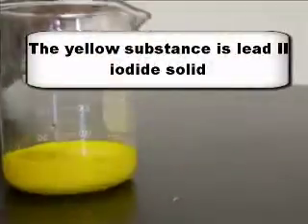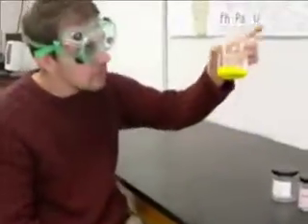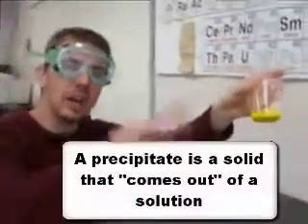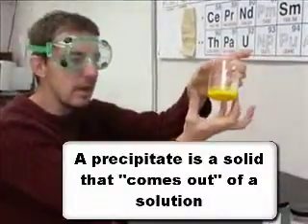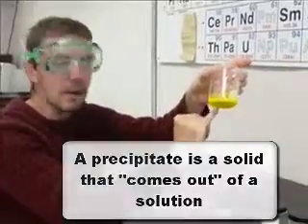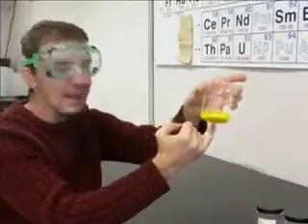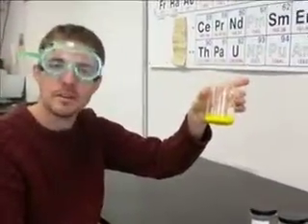Whoa! So our two clear and colorless liquids formed a yellow solid. Now if you get real close here, you can see that it's a solid that's formed. It didn't just turn into a yellow liquid. You can see chunks that are settling down to the bottom. We call that a precipitate. Now don't confuse that with precipitation, like rain coming down. This is a solid precipitate. The solid precipitate comes out of the solution and settles down to the bottom. So two ionic compounds in solution, mix them together, and you form a solid ionic compound that does not dissolve in water in a double replacement reaction.